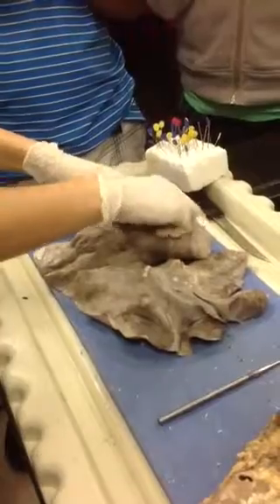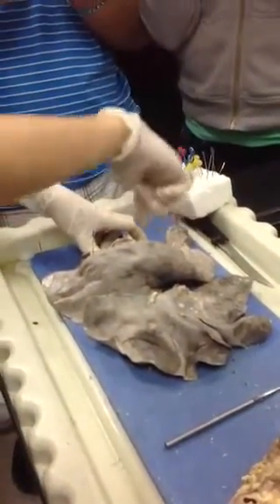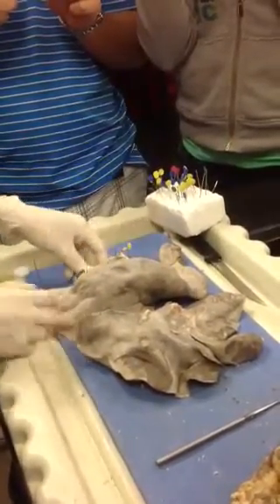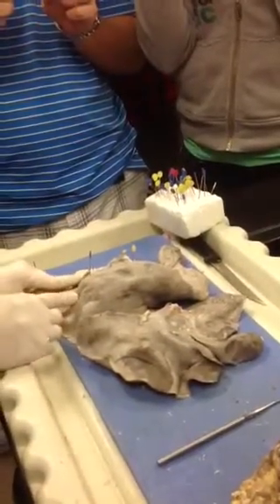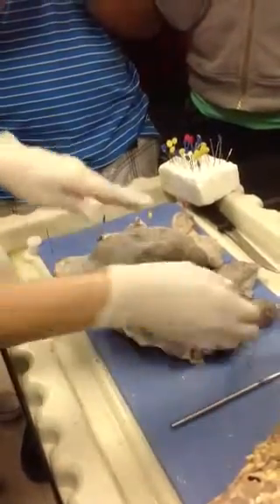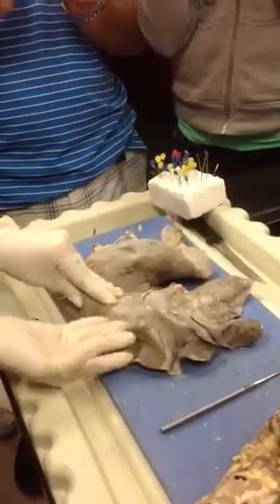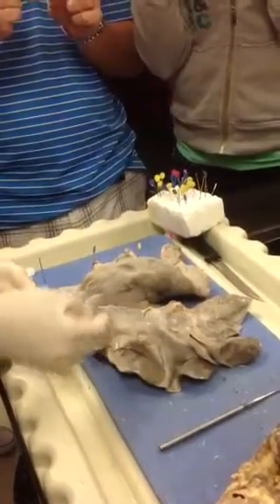All right, don't worry about identifying the fissures on the dissections, but on the models, you should be able to. So the fissure that separates the right superior from the right middle lobe? Horizontal. Is the horizontal fissure. And then the one that separates the right middle from the right inferior, oblique fissure. Right oblique fissure. Now on this side, since we only have 2, what separates the left superior from the left inferior lobe? Oblique fissure. Left oblique fissure. Good.